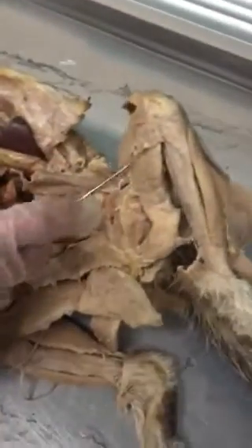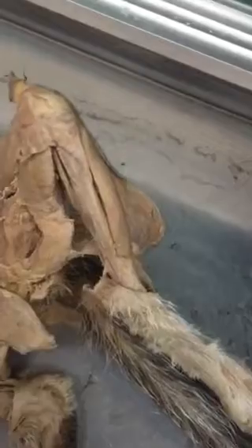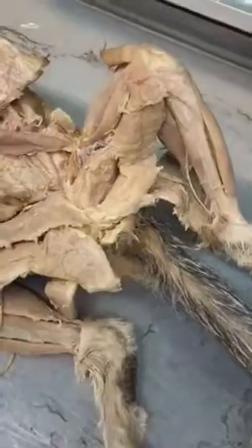Okay, so you have vastus lateralis, which you could also see from the side of the thigh, rectus femoris, vastus medialis, and under the rectus femoris is the vastus intermedius. Those are the four quad muscles. Where's the intermedius? It's under here. It's the muscle under the rectus femoris. Those are the four quadriceps, okay?